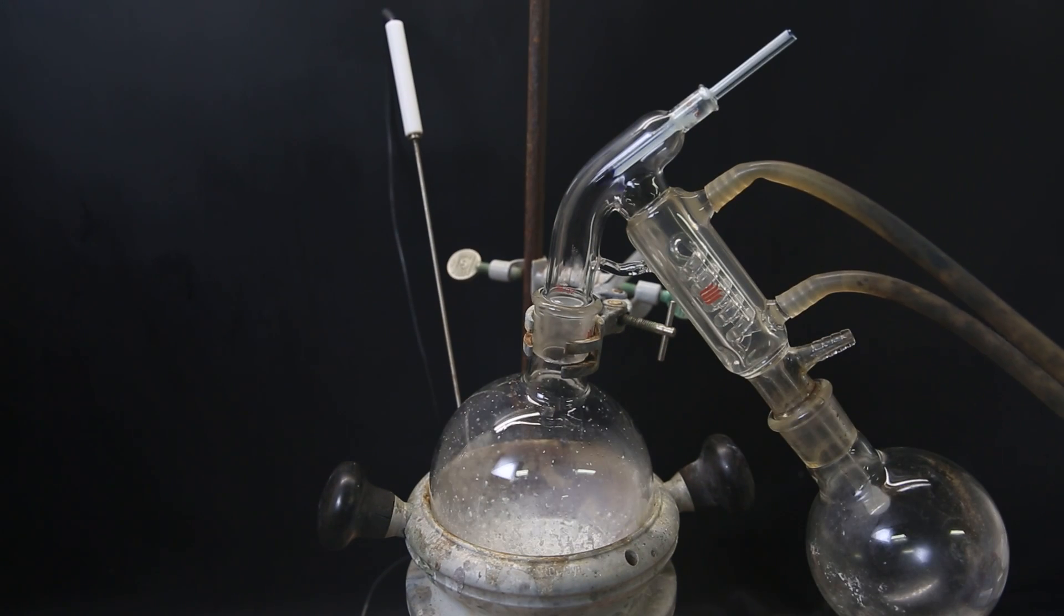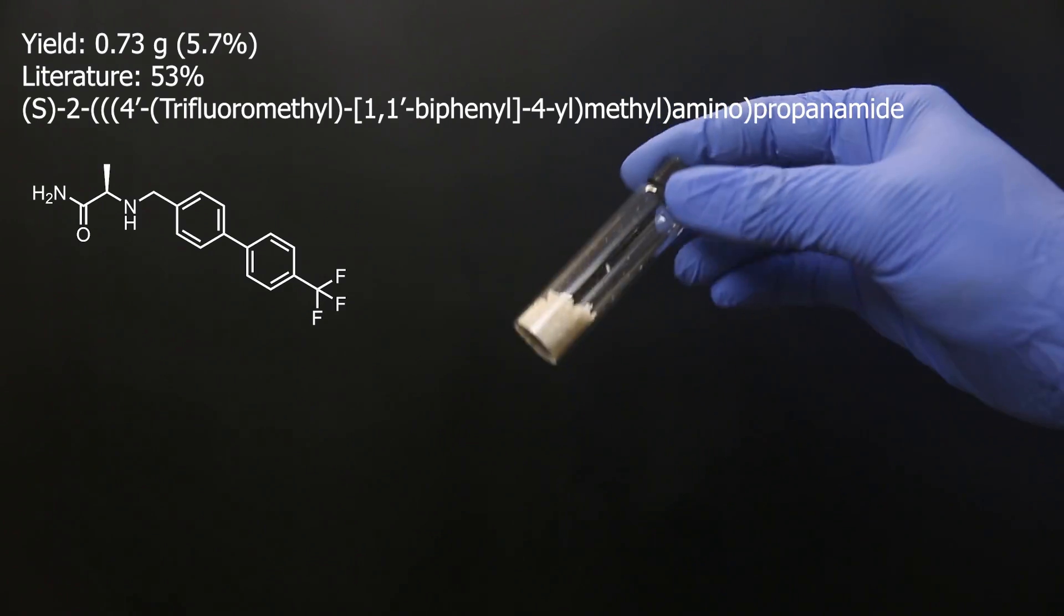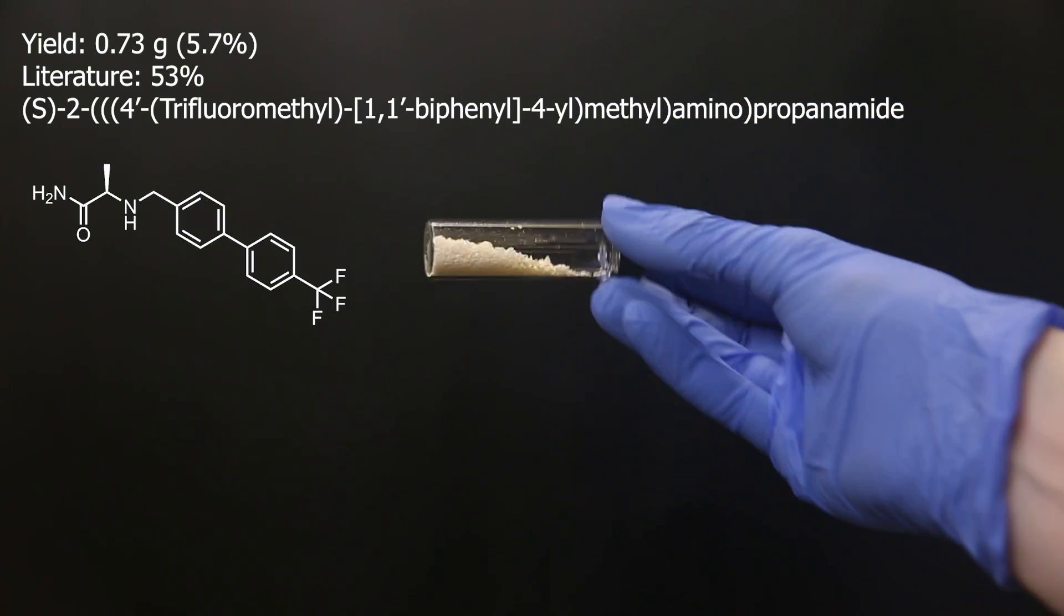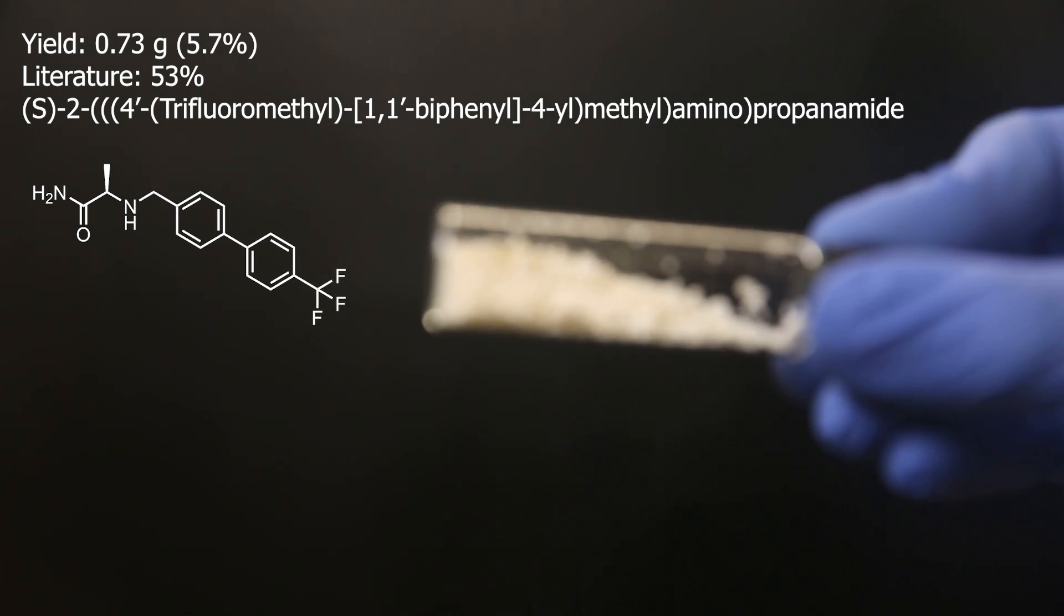Then a small amount of slightly off-white solid is left behind. That should be the final amine product. The yield turned out to be 0.73 grams, which is a very sad 5.7%, compared to the 53% from literature.